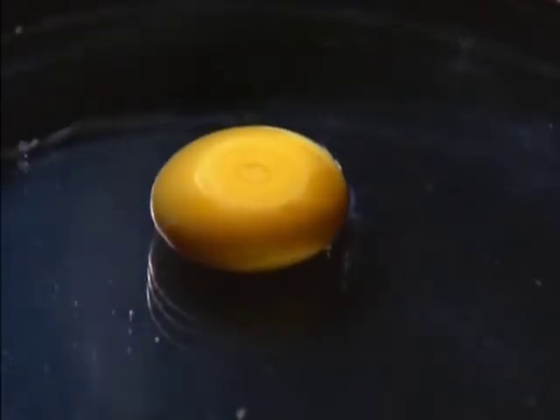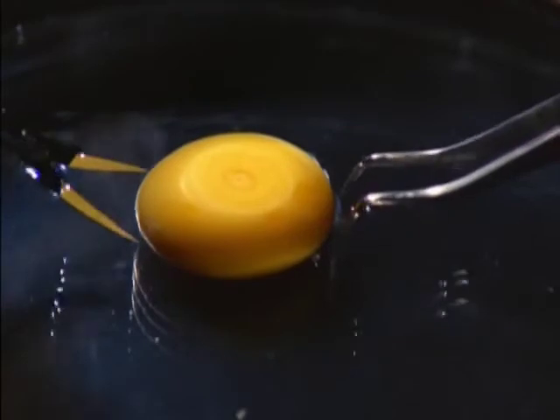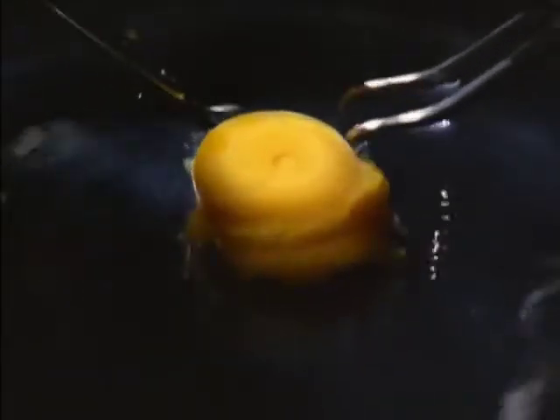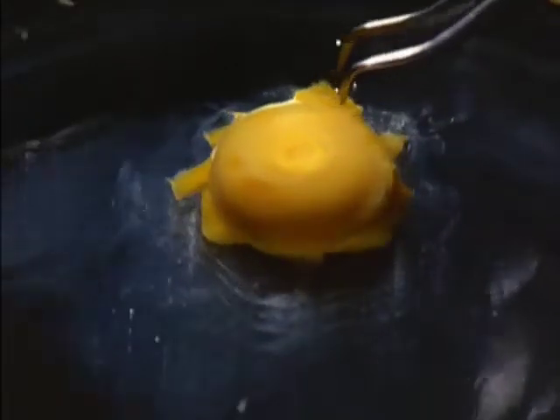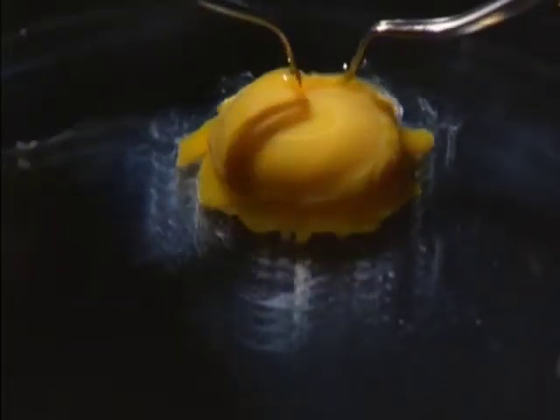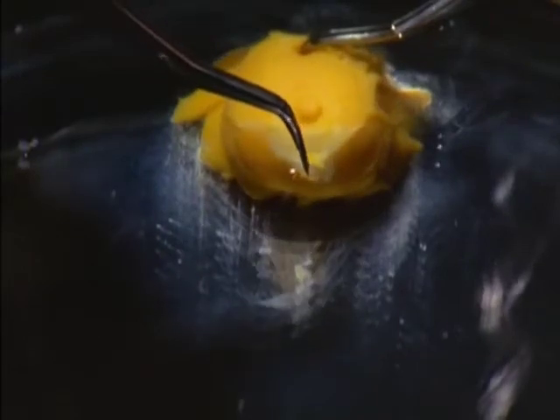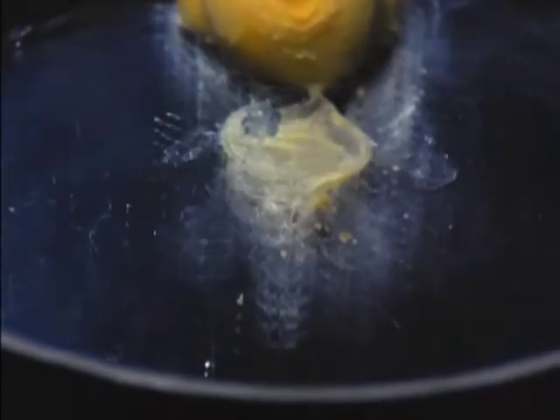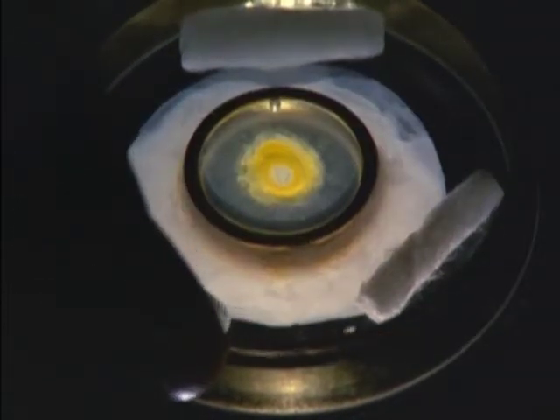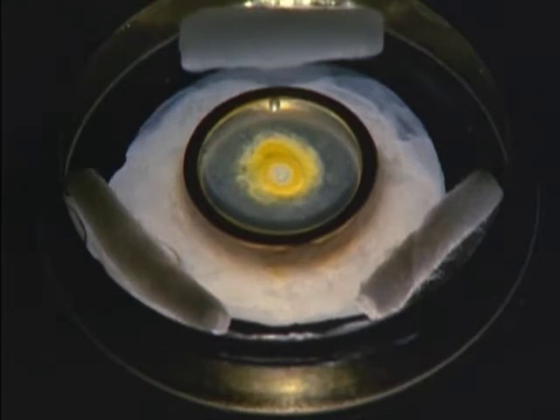This is a fertilized egg of a hen. The tiny whitish spot on the yolk is the blastodisc, which corresponds to the embryo bud in a seed of a plant. It's a mass of cells which have already multiplied from a single egg cell following fertilization. The blastodisc is now removed along with the thin membrane wrapping the yolk in order to cultivate it with artificial nutrients. The blastodisc is placed in the culture fluid inside out to facilitate observation. This film closely studies the intricate processes of the embryonic development of a chicken.